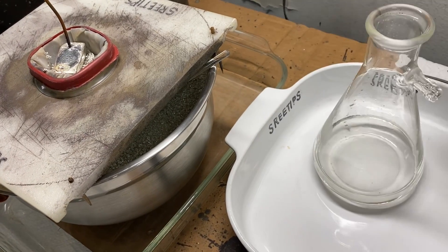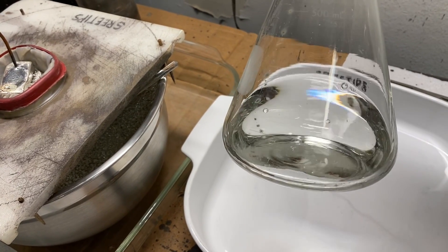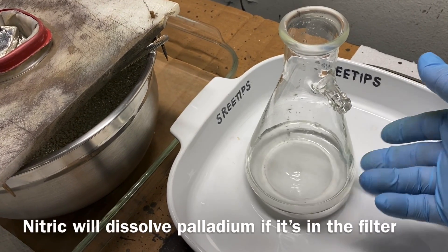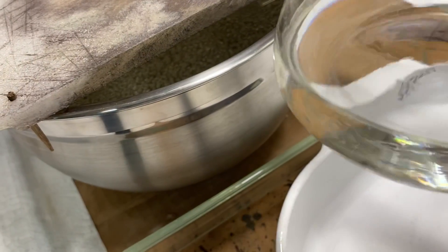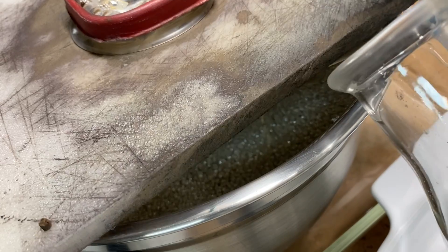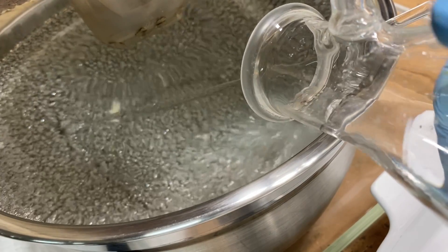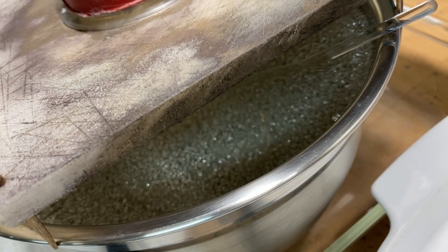What I have in this bottle right here is a little bit of silver nitrate electrolyte that I prepared earlier. There's about 150 grams of pure silver dissolved in hot dilute nitric, and all of the available nitric has been consumed out of here, so I'm not going to be putting any nitric in the cell. We're going to take this electrolyte and add it to the cell. This will replenish the depleted silver nitrate in the electrolyte and fill the physical level back up to the correct level.